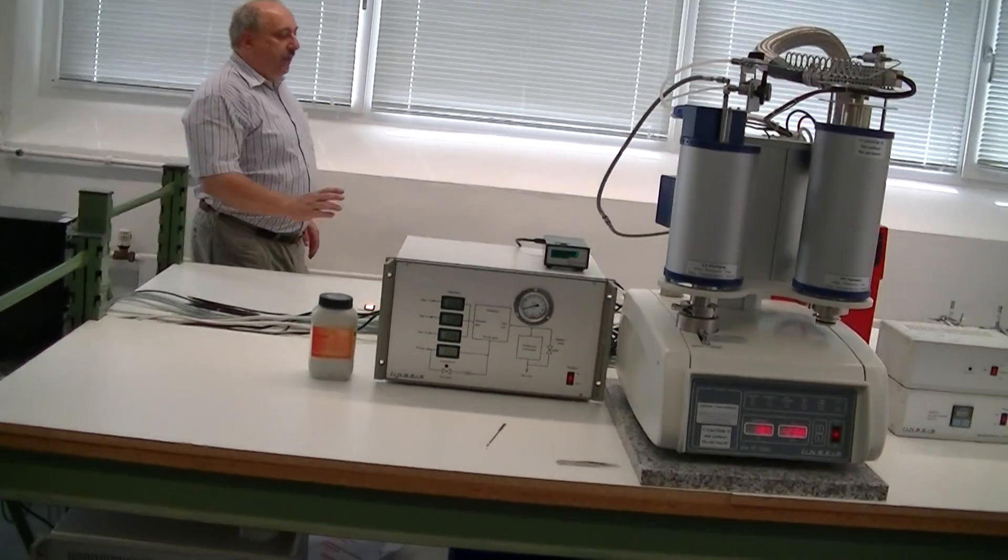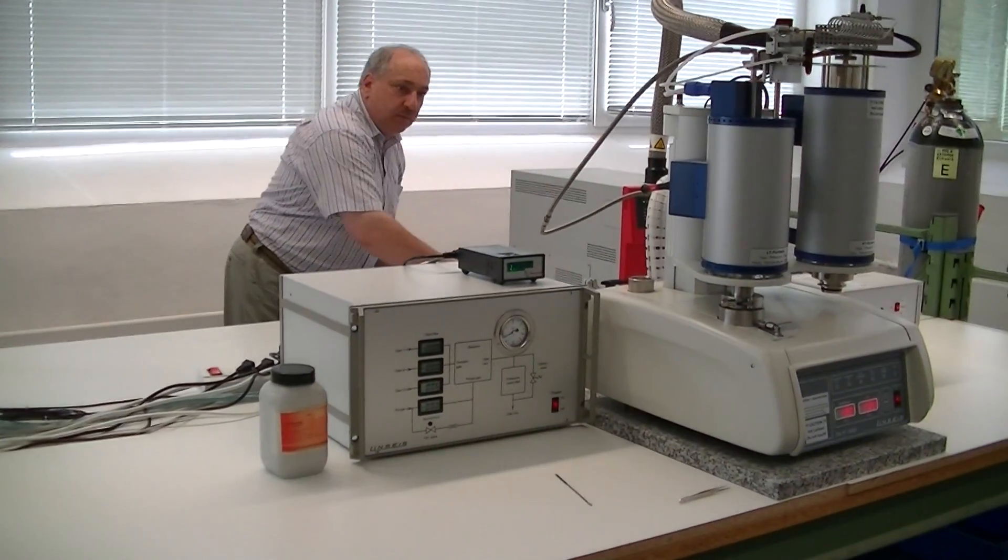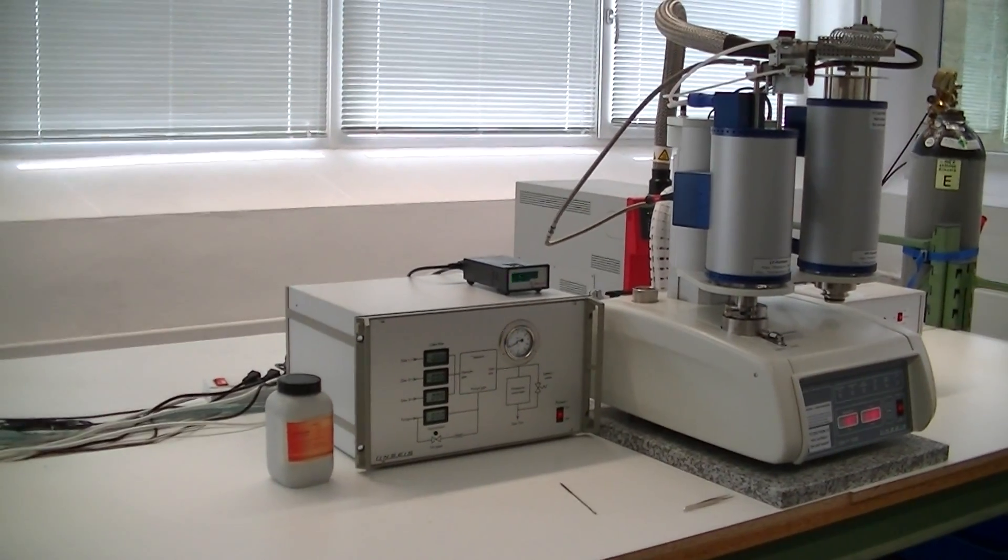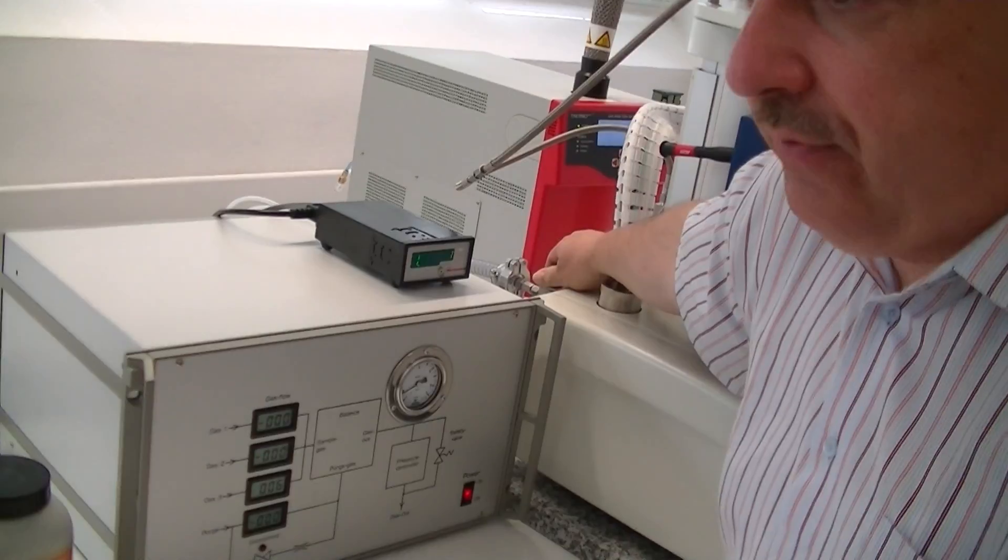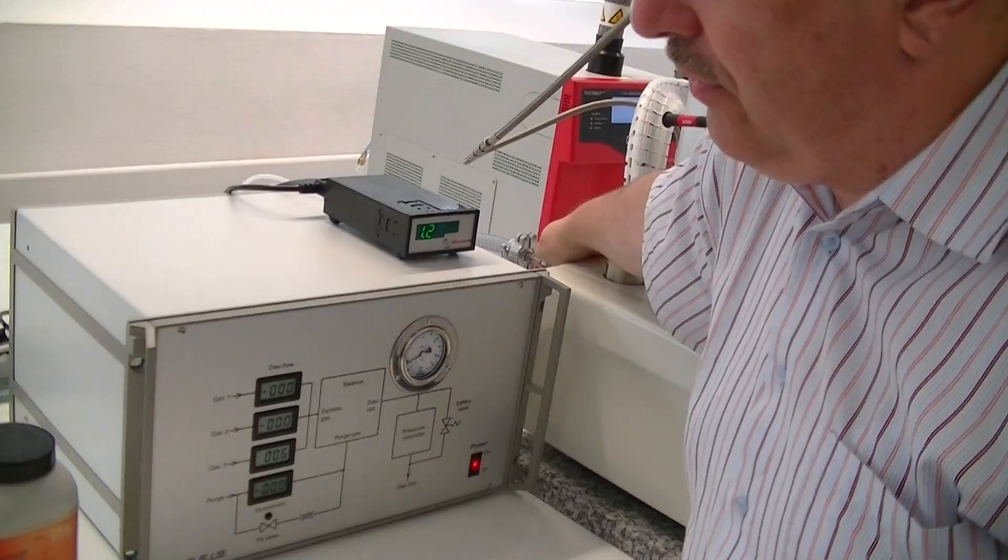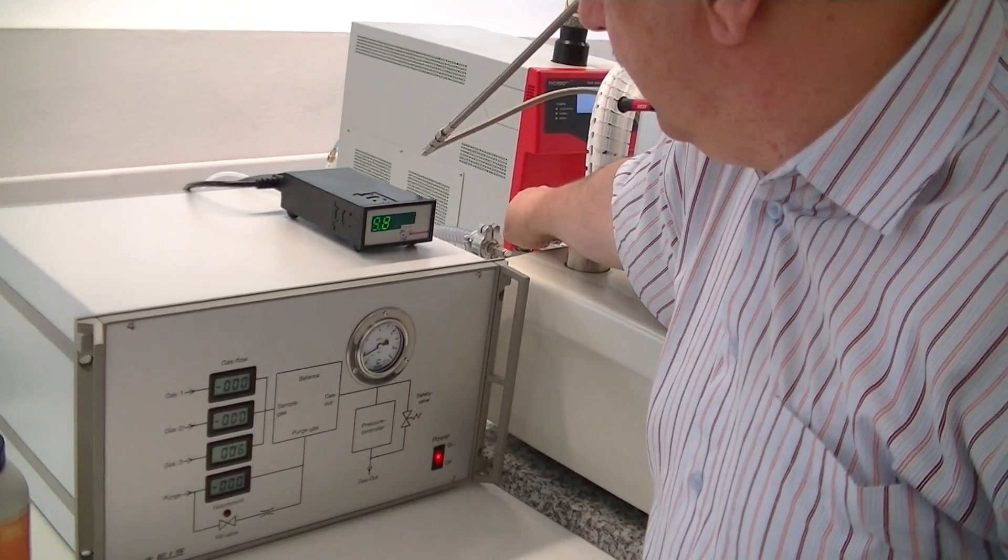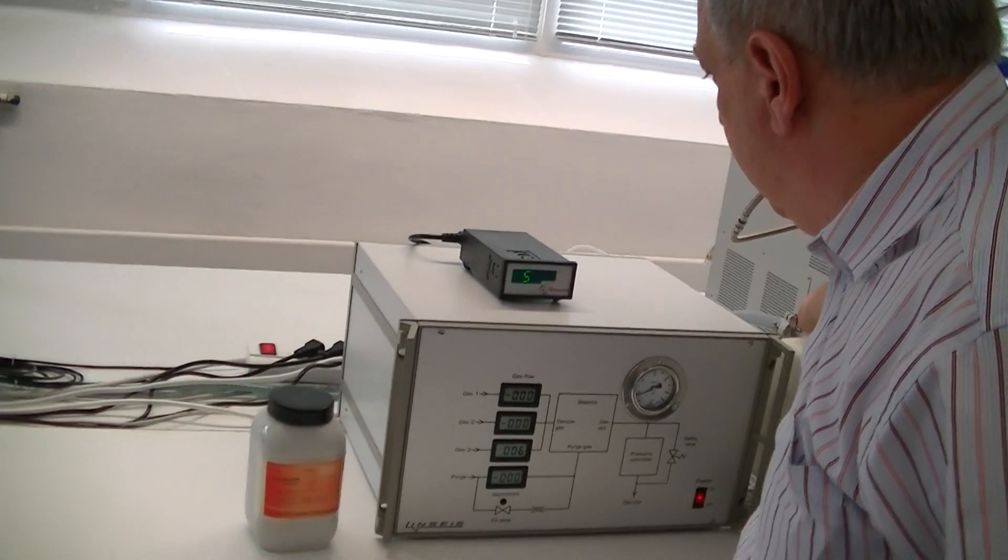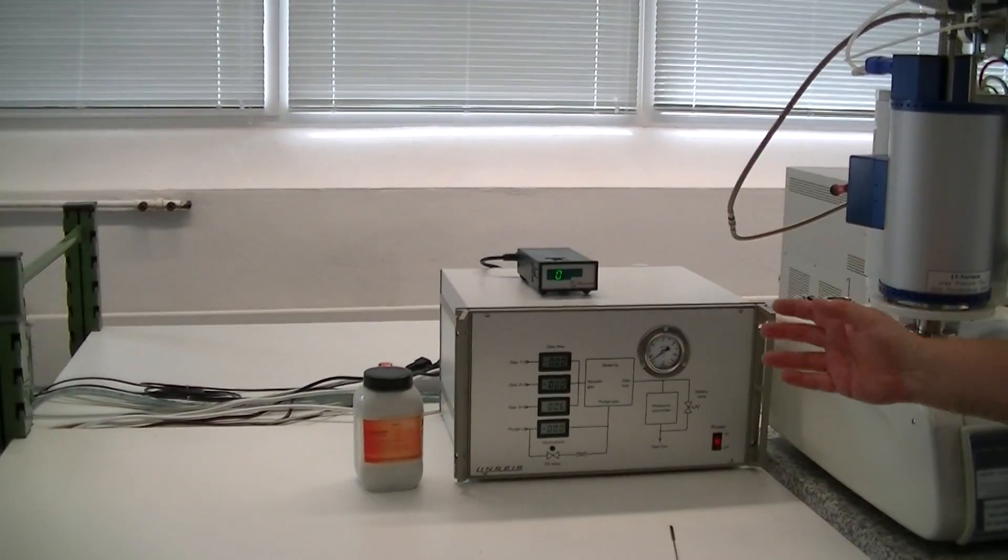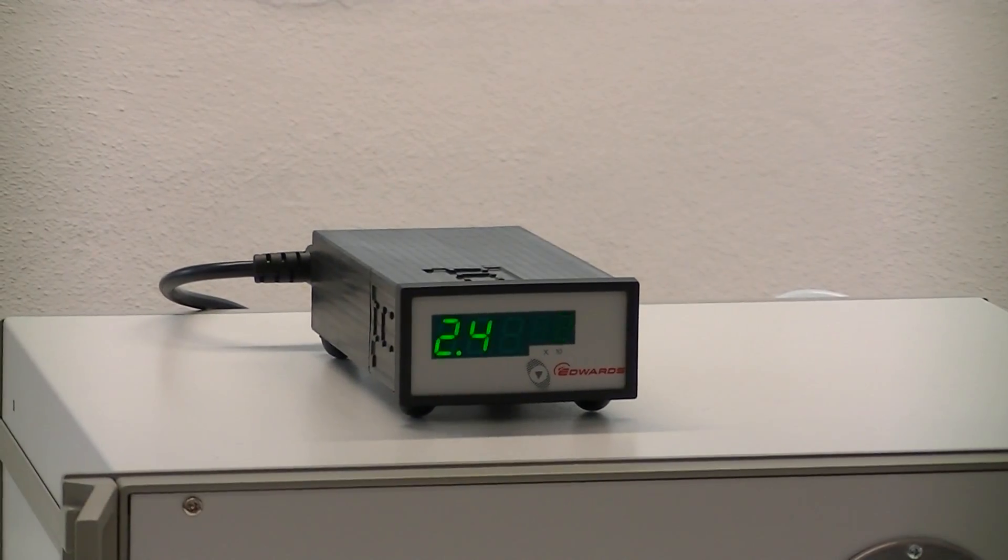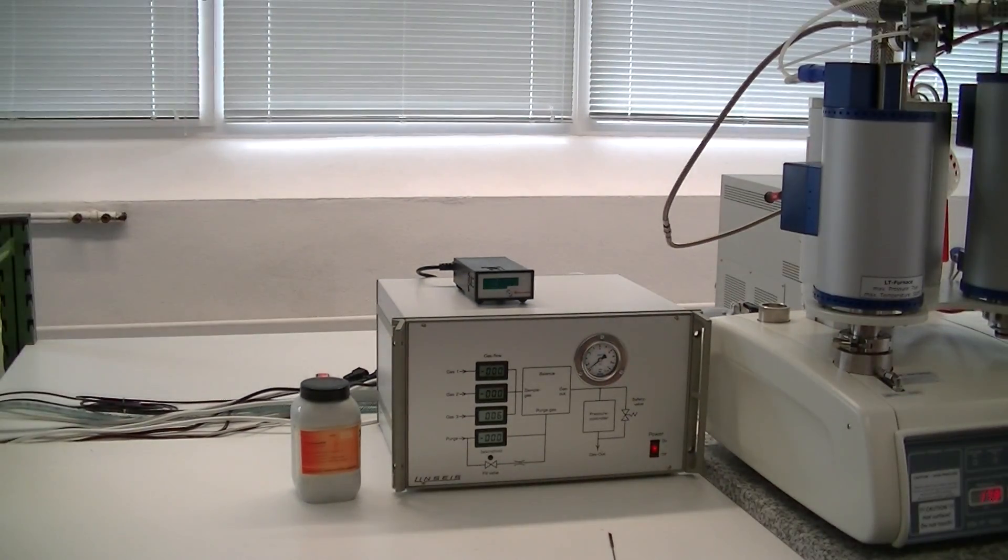The pump is over here, so we do it from the back side. So the pump is now running. And to evacuate the system, we have to open the vacuum valve. The vacuum valve is around here. And normally you have to open the valve very slowly, not to suck out the sample or powder of your sample. The vacuum valve will be indicated here with the gauge. So now you can pump down the system to the level you want. It depends on how long you pump and how good the system is sealed. So we don't want to wait for a long time to demonstrate this.